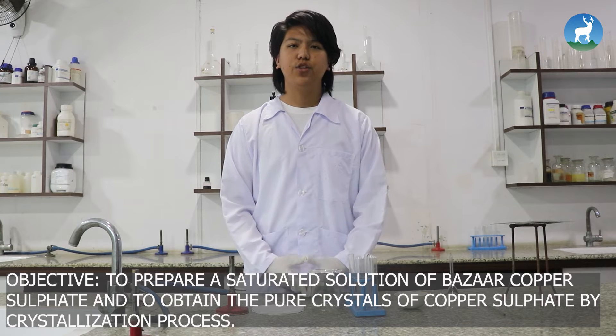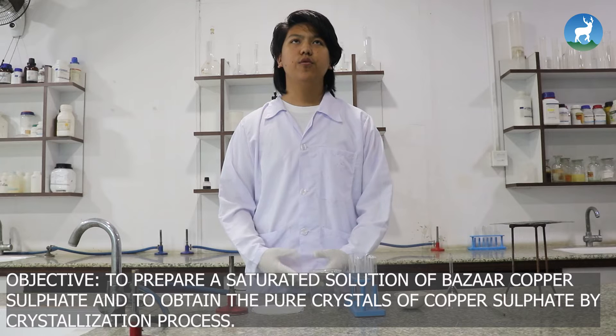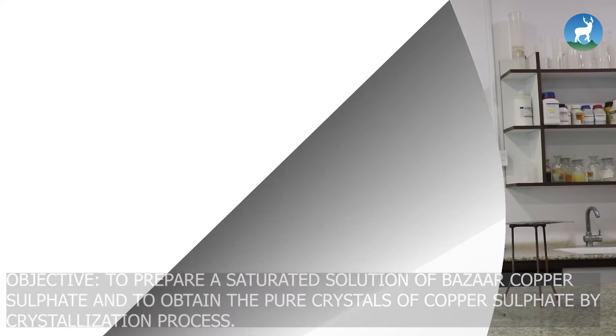The objective of this experiment is to prepare a saturated solution of bazar copper sulfate and to obtain crystals by crystallization process.